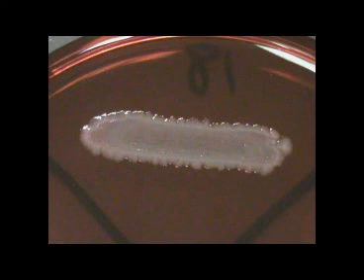Here, a gram-positive organism was inoculated on the plate. Pictured here is a non-fermenting organism. This organism would be considered a non-coliform. Now shown is a slow-fermenting bacteria. Although this organism is a coliform, it is thought to be naturally occurring in the environment.